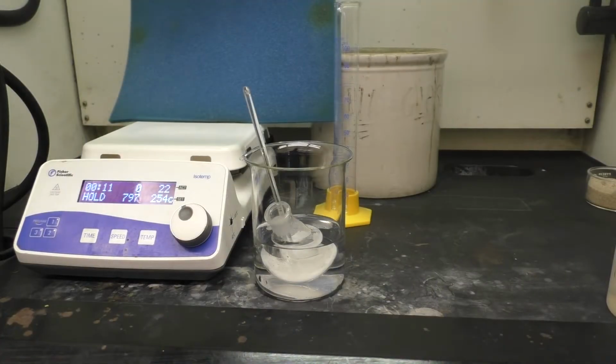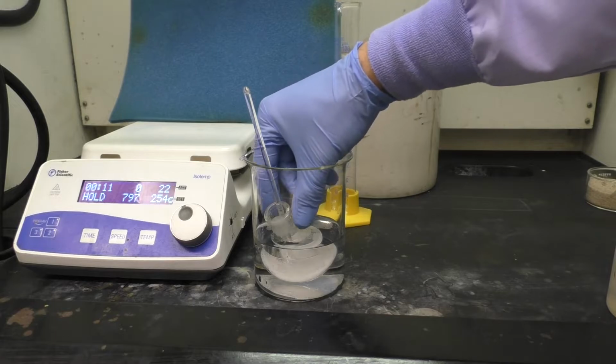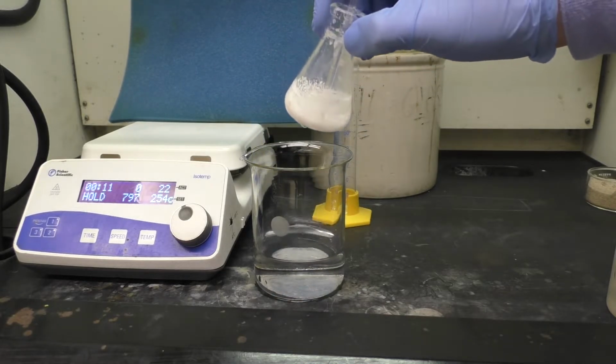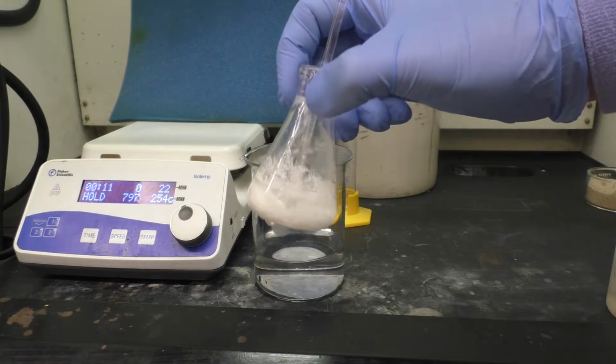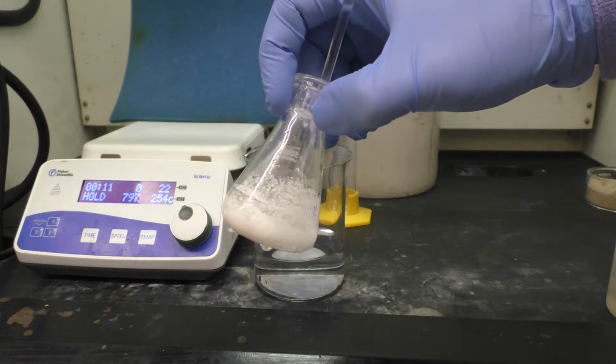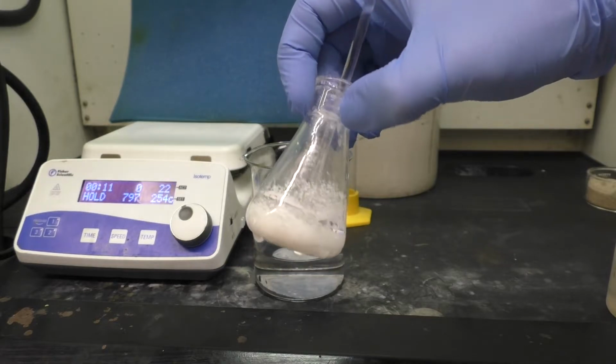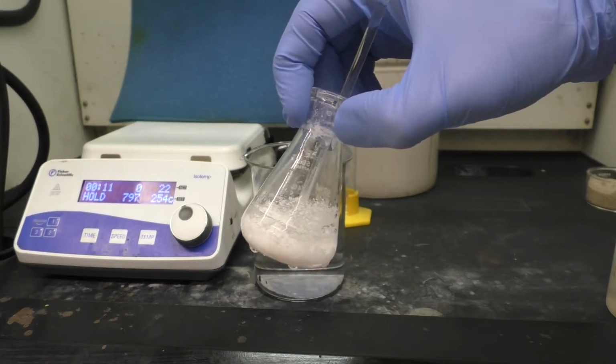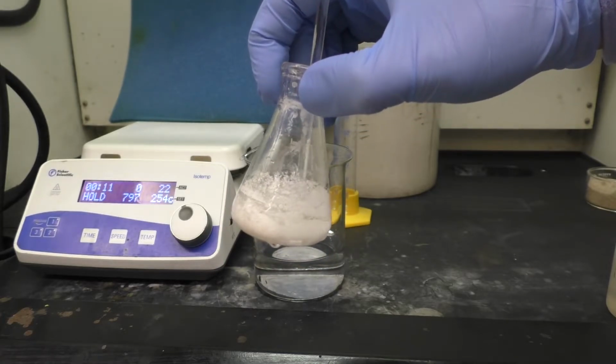So now we've left the Erlenmeyer containing the product in the ice bath for quite a while now. Actually, all of the ice is melted. And what you can finally see, it took quite a while for it to precipitate out, but now you can see a nice white solid, not very crystalline perhaps, mostly more precipitate-like, but there's now material here, so we can collect this now by filtration.